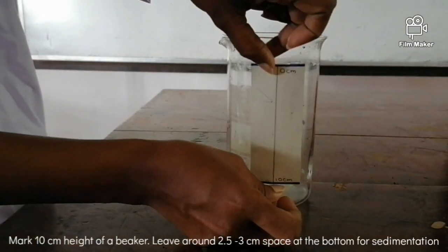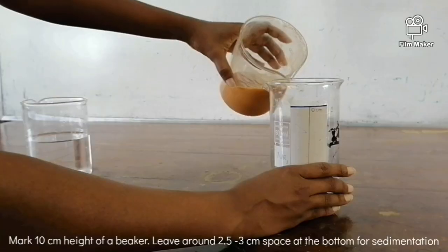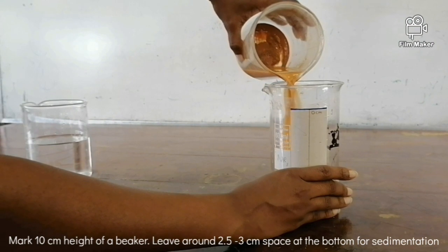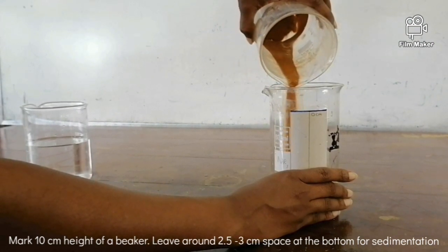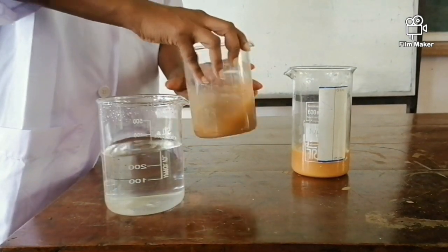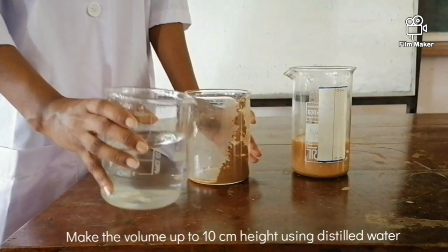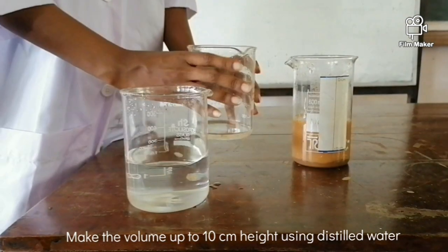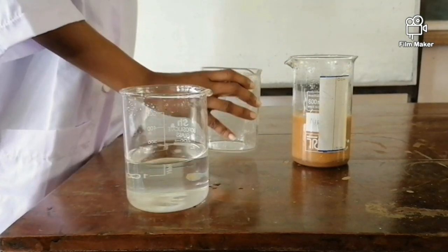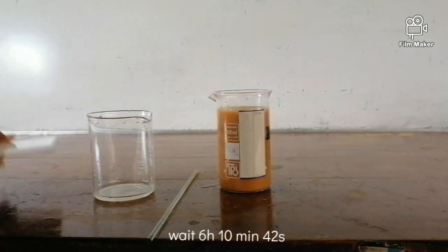Now transfer all the contents into a 600 ml tall beaker with a stripe marking at the 10 cm mark. Then make the volume up to a height of 10 cm using distilled water. Stir the mixture thoroughly and allow the suspension to stand steady on a laboratory bench, noting the time at this point.